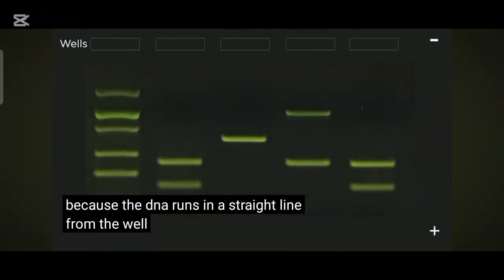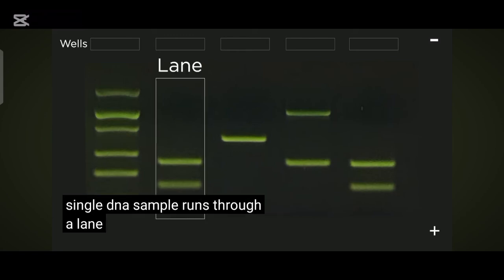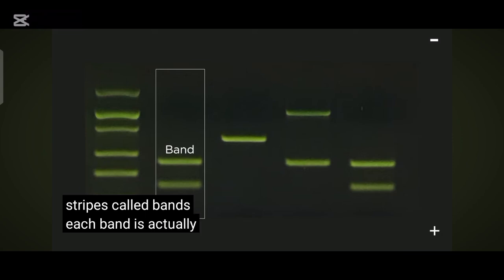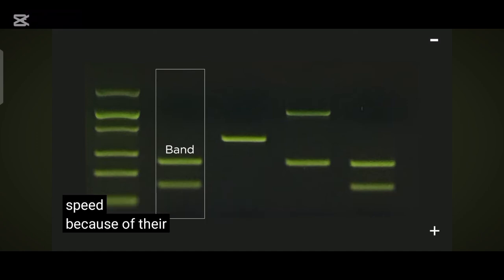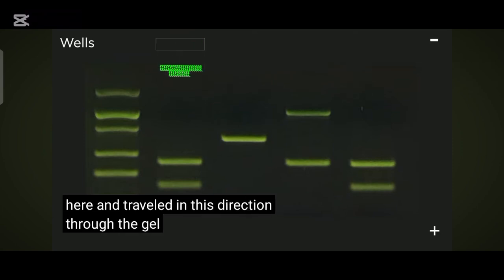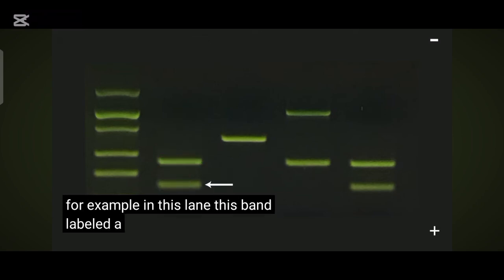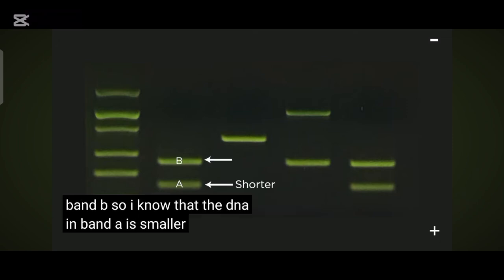Because the DNA runs in a straight line from the well towards the far end of the gel, we call each region that a single DNA sample runs through a lane. The lanes in the middle represent the DNA in each of our samples. We may see a lane with two bright stripes called bands. Each band is actually billions of DNA fragments all of the same length that all moved through the gel together at the same speed because of their identical sizes. For example, a band labeled A that has moved farther through the gel than band B tells us that the DNA in band A is smaller than the DNA in band B.